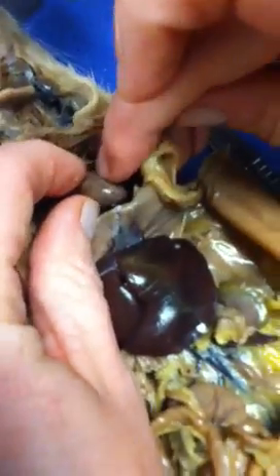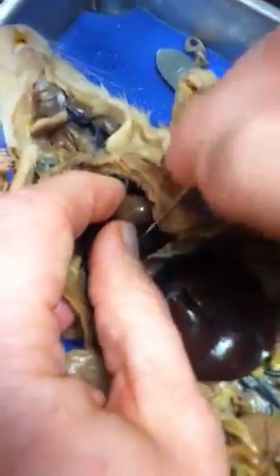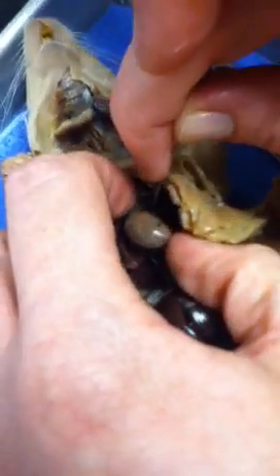Okay, this will be your right or your left ventricle. Then your right ventricle would be on this side. So that means that this would be your right atrium, left atrium. These would be your right lungs, and then your left lungs. And then we have your special gland that is called your thymus gland. We have this part. Diaphragm.